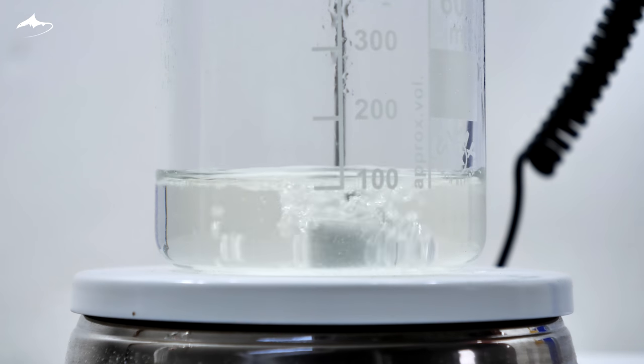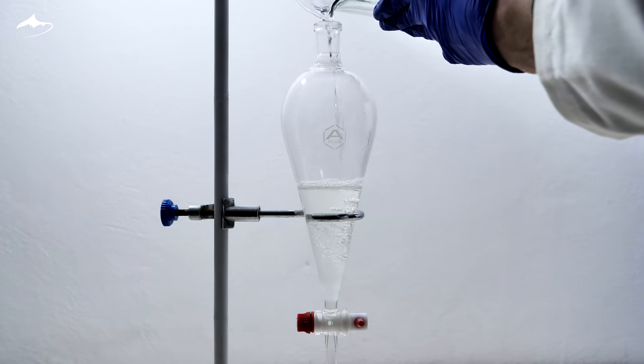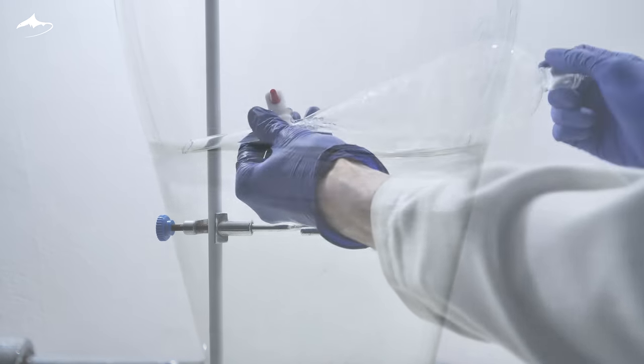The volume is reduced to about 100 ml, and just in case, it is then extracted once with 10 ml of ethyl acetate.